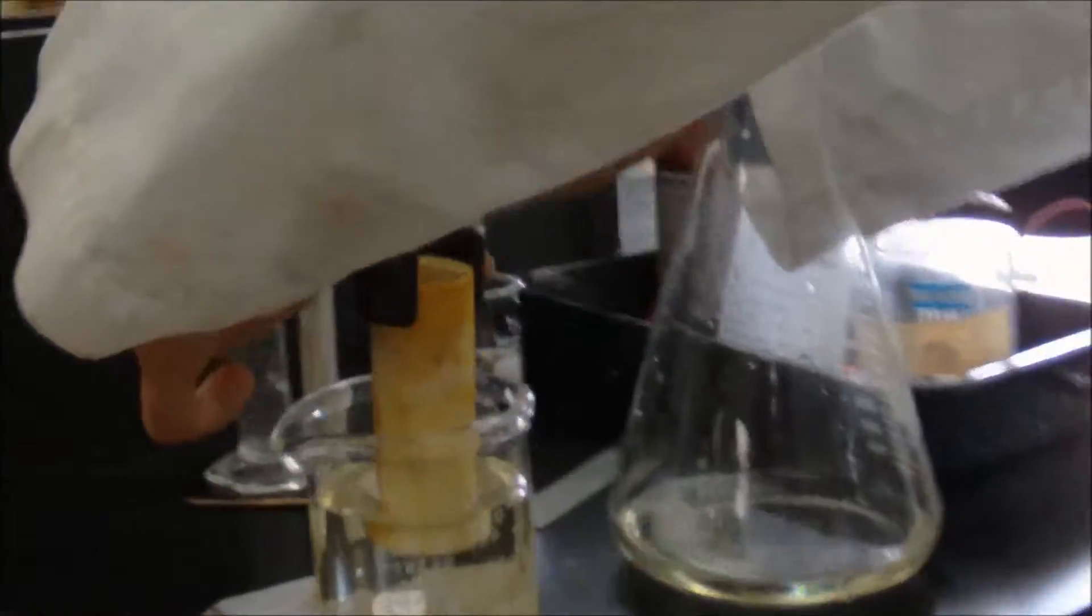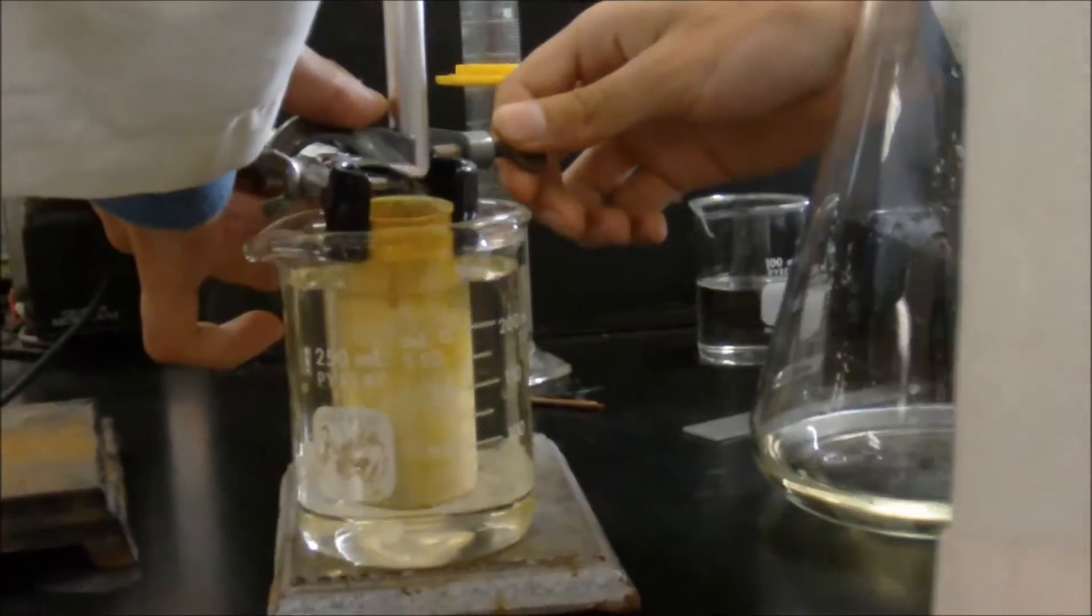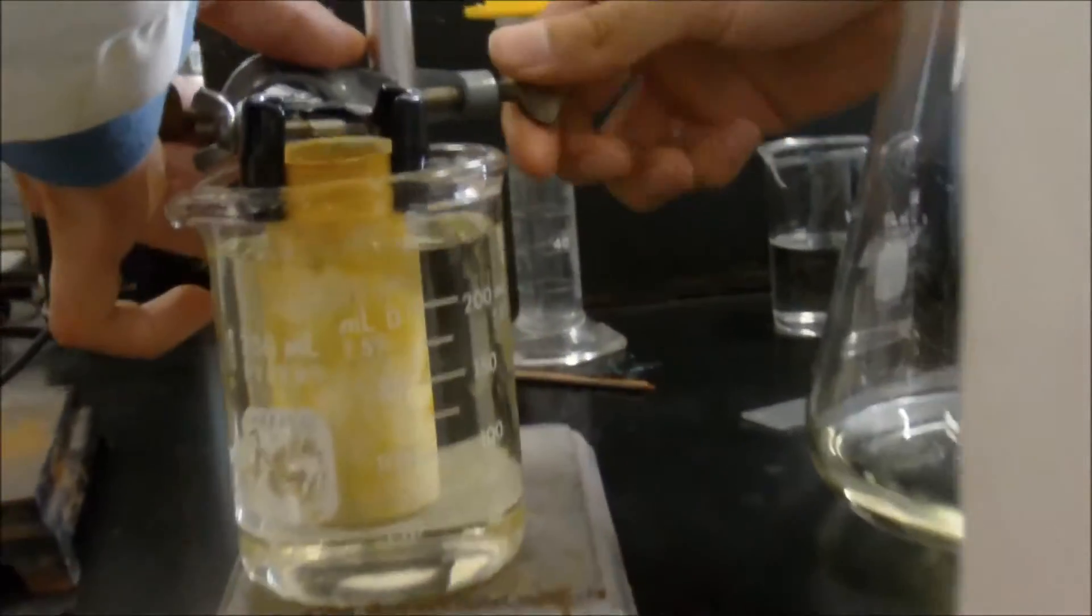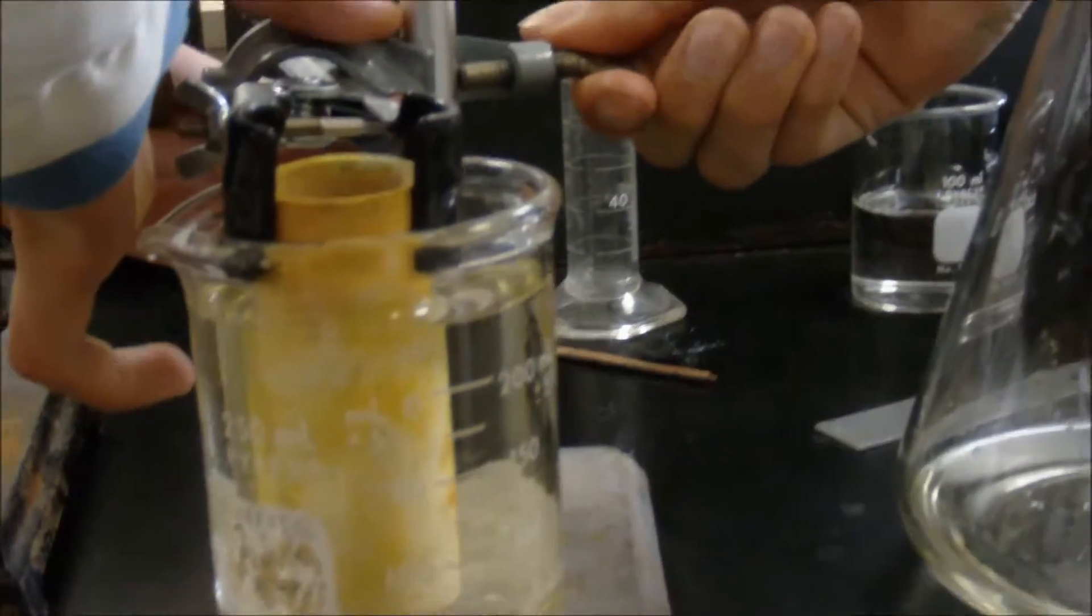So now I'm going to lower the porous cup into the solution. And there we go.